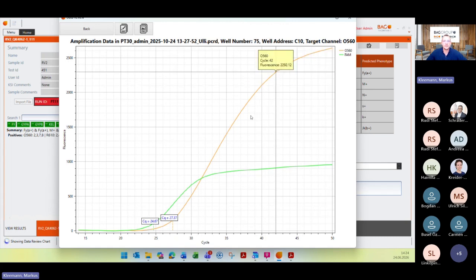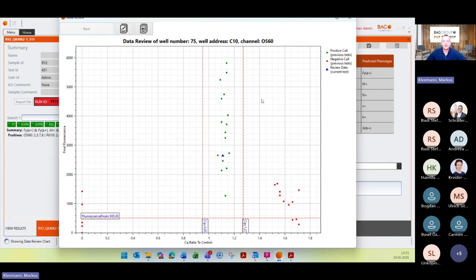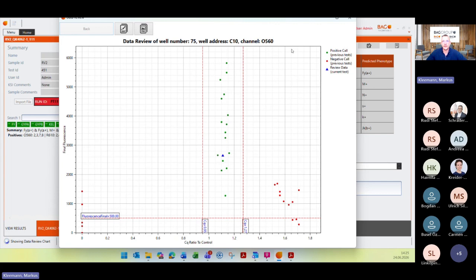If the shape of this curve is like this one here, like this sigmoidal one. And these 3 parameters lead to the quality score and can differ. For example, if the fluorescence was too low, or if the CQ was a little bit too low or too high, and lead to the different quality scores in this case.